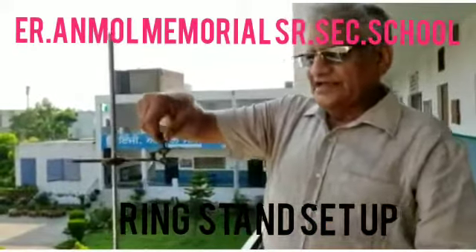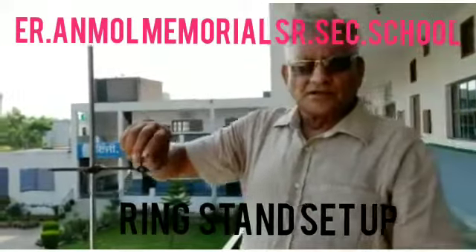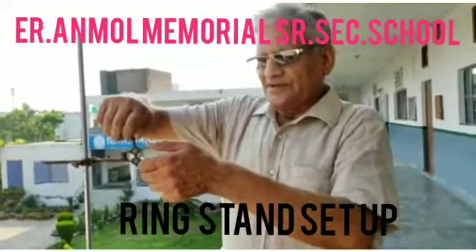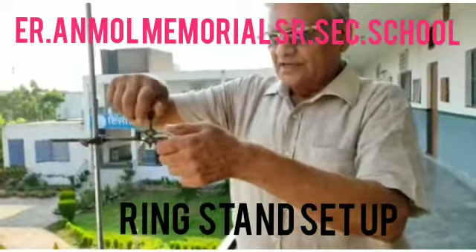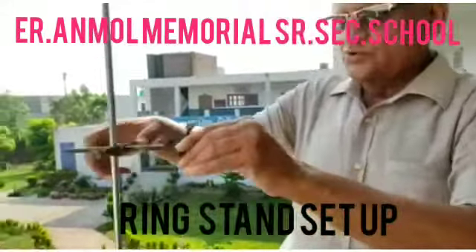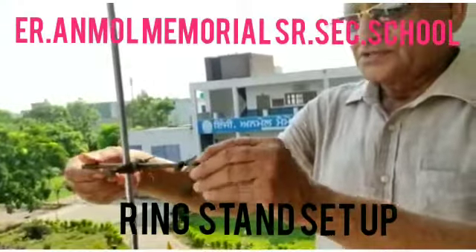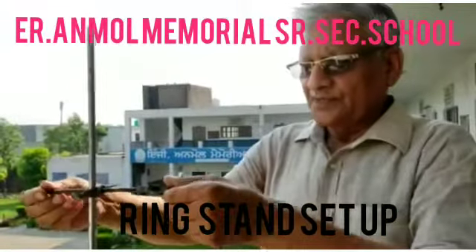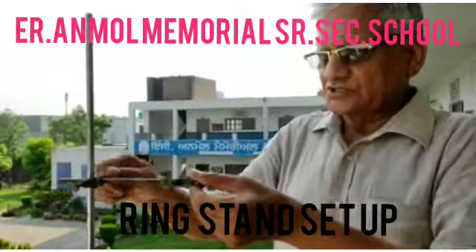By turning it anti-clockwise you will adjust and make the space more here. By adjusting this screw you can revolve it also. You can revolve it from this screw, and you can bring it backward and forward from this screw.